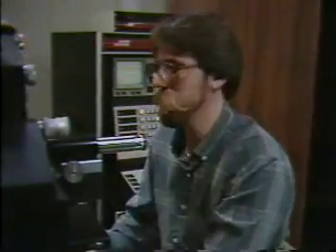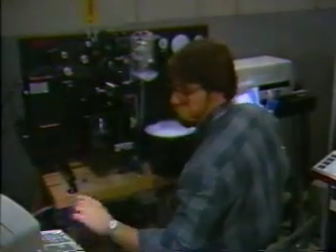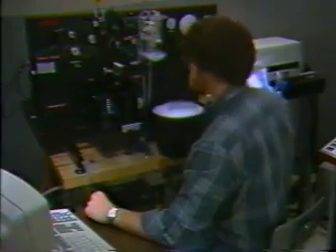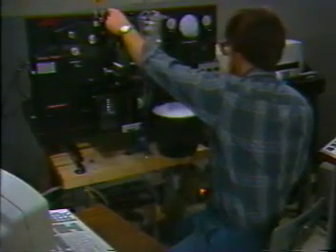You are watching Keith Kelly, head cell sorter operator for BDIS. He is using FACS Desk to collect data for an experiment that was prepared by one of his colleagues. Keith looks pretty relaxed for someone running a 4-parameter FACS analysis. That's because FACS Desk is doing most of the work.